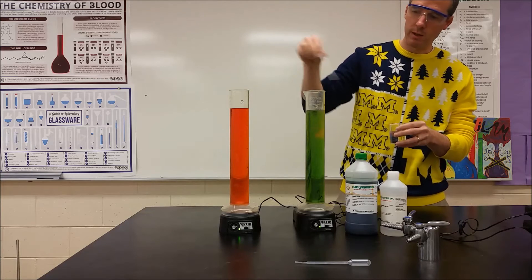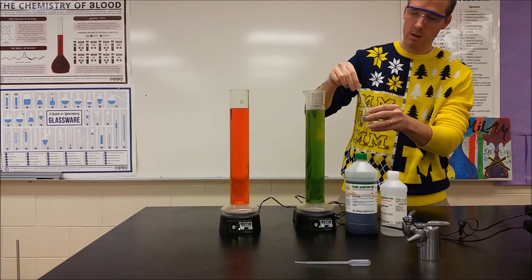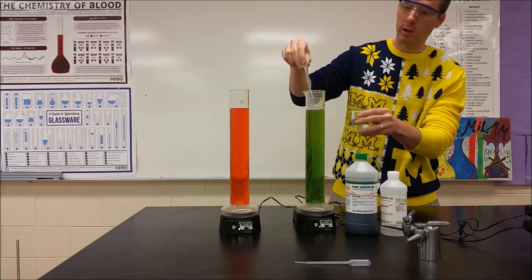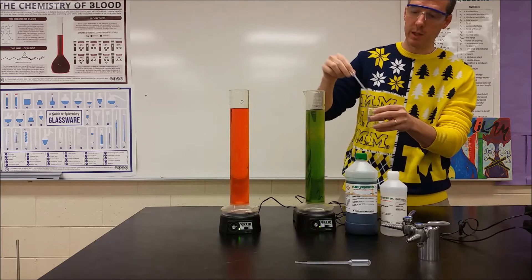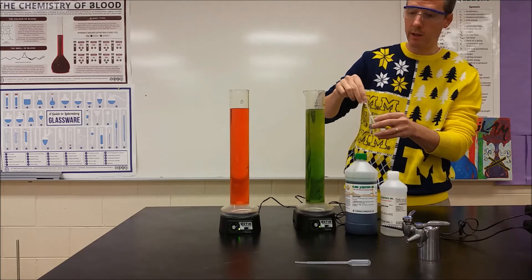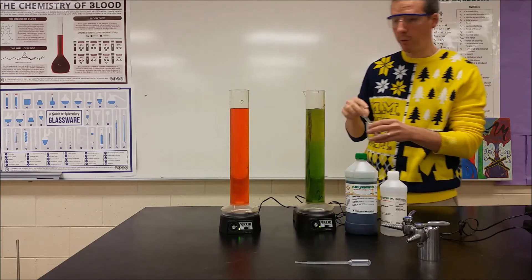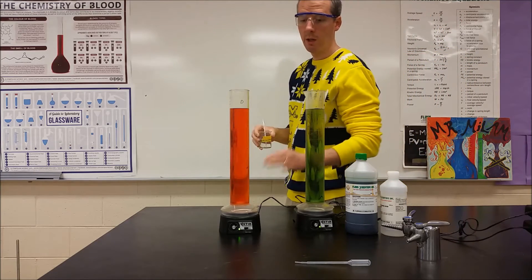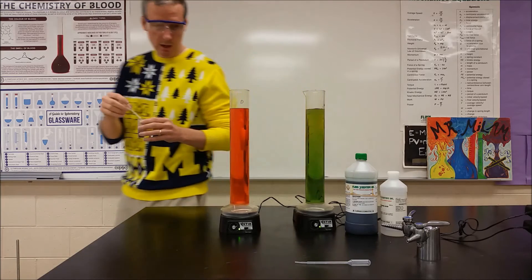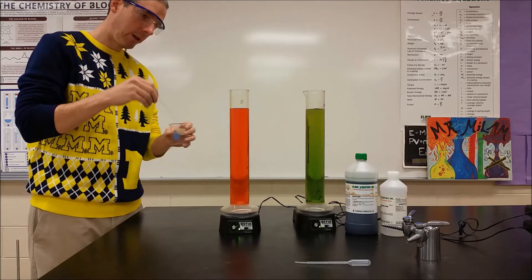And so we can continually add, add, and add hydrochloric acid to this. And we see that it resists that change of pH really nicely. We still, even though I've probably added a good 10 milliliters of this, really not gotten to a point where we can even approach two milliliters in the distilled water. We're going to go ahead and add another milliliter over here. This would be milliliter number three for the distilled water.